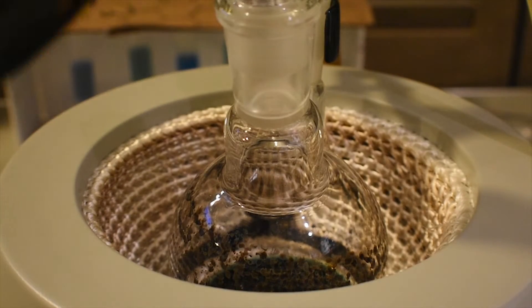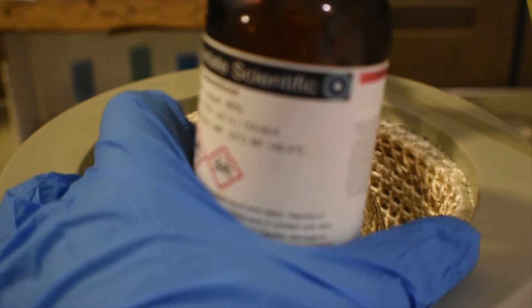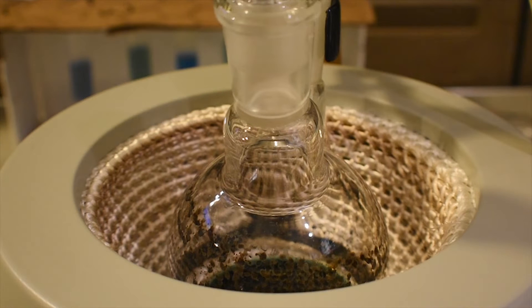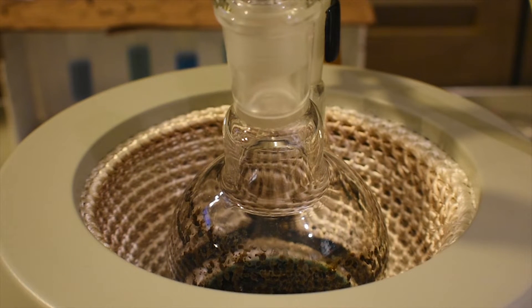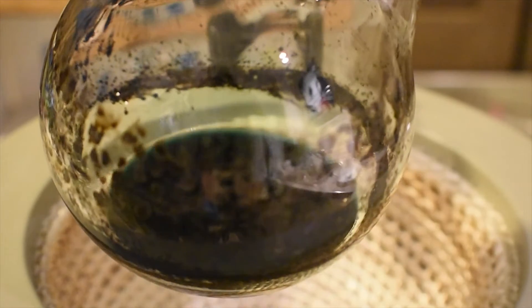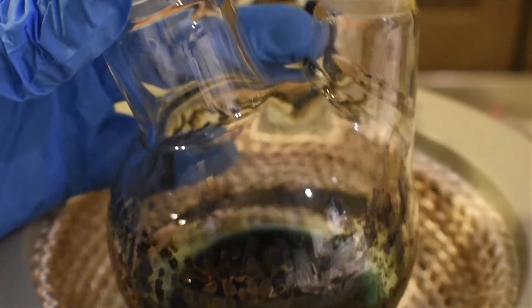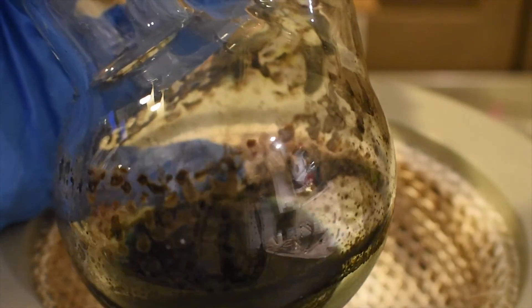It's the next day. This has had about roughly 18 hours to cool, so I'm going to go ahead and disassemble everything and filter the solution. I can't help but notice, upon disassembling all this, the smell of apples, which is probably acetaldehyde. What we're left with in the flask is a dark blue-green solution — actually it looks sort of greenish on camera, but it's a really dark blue solution of vanadyl sulfate in a partial water-ethanol solution.